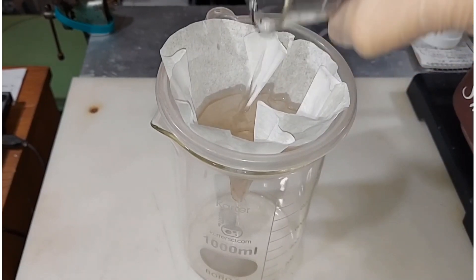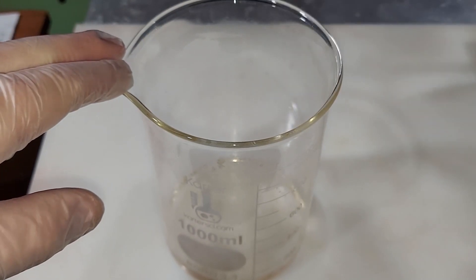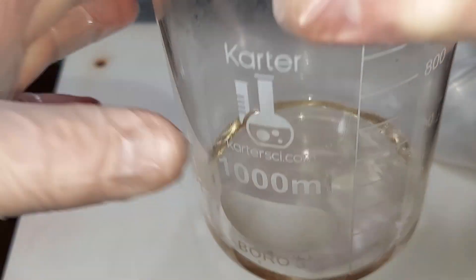It's done filtering, and I did that just to make sure that any undissolved lead oxide would be taken care of. So here's our pure lead acetate solution.